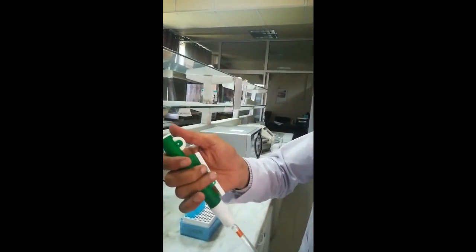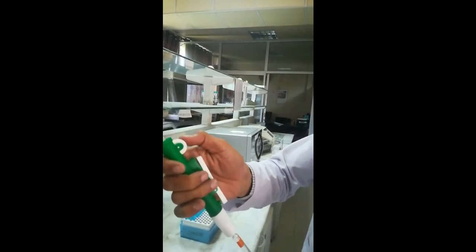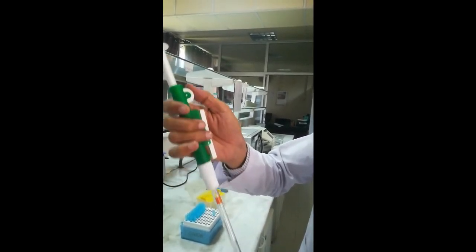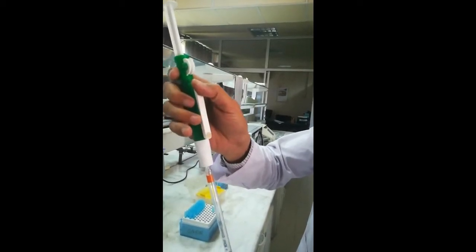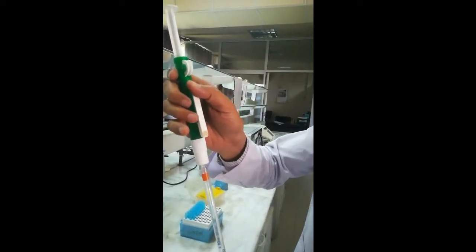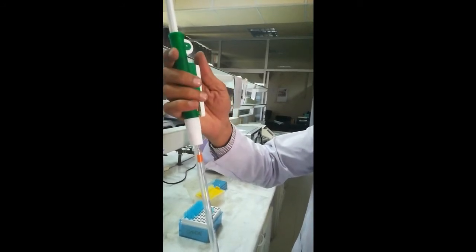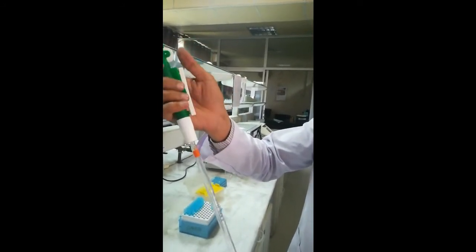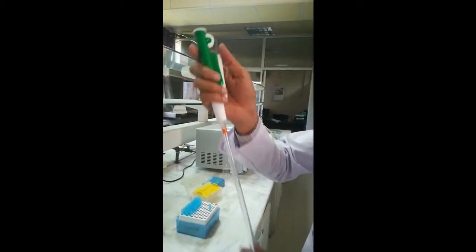The first is a circular knob — this circular knob helps us to suck the solution into the pipette. The second button helps to pour the measured liquid out from the pipette. Here we can demonstrate how it works.